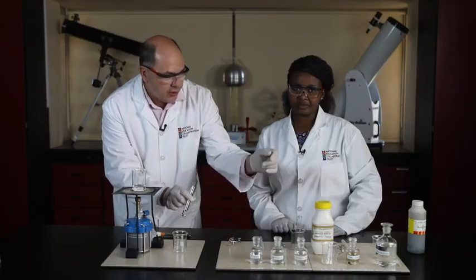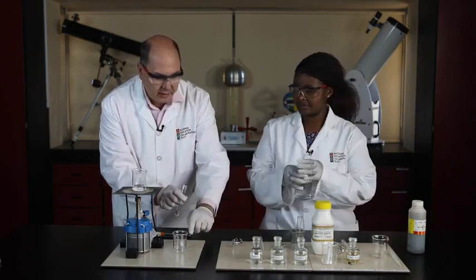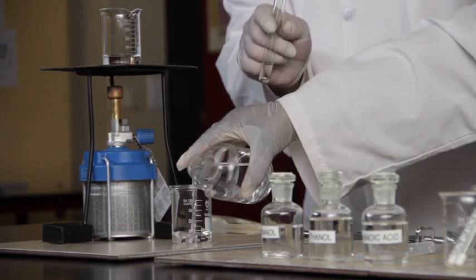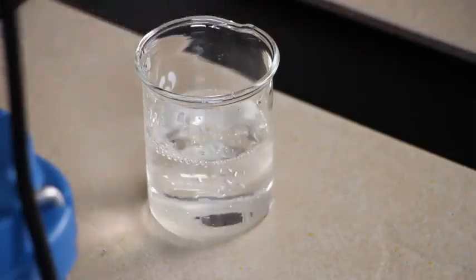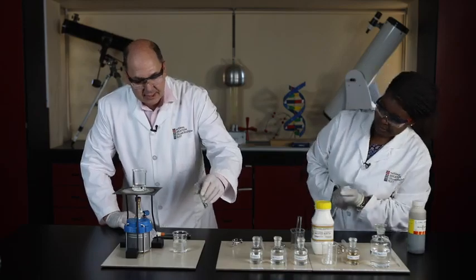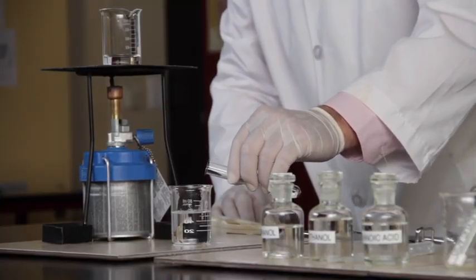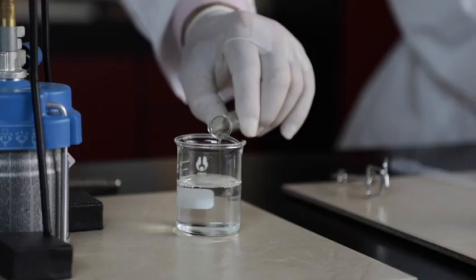So, Joyce, won't you bring some sodium carbonate from there? Let's put, yeah, there we go. Fill the beaker with sodium carbonate. Looking beautiful. And now we're going to get some reaction. Let's see what happens. Just slowly, slowly add the reaction mixture to sodium carbonate.